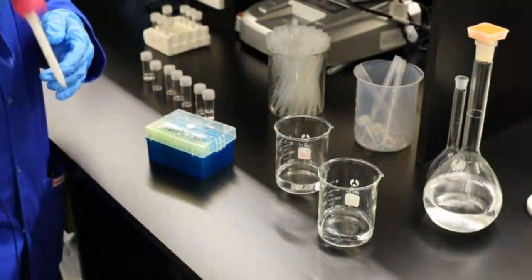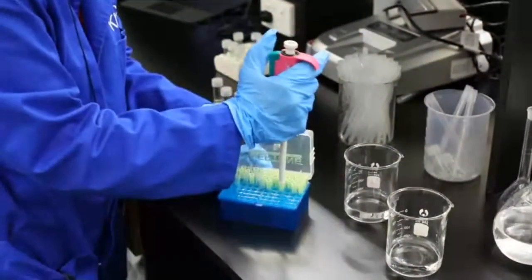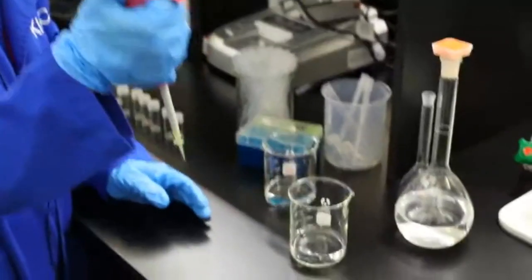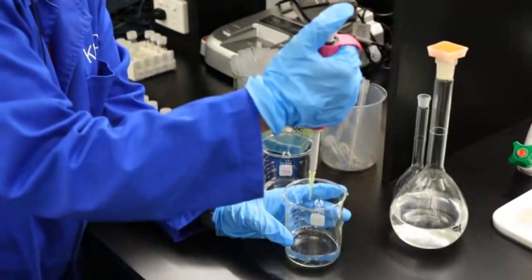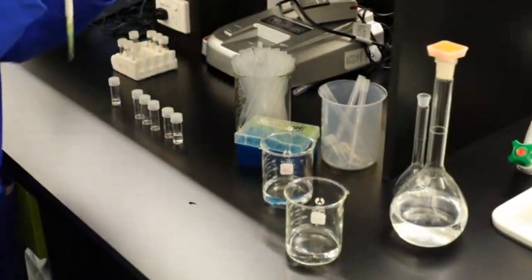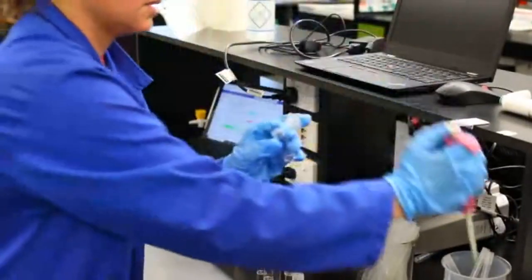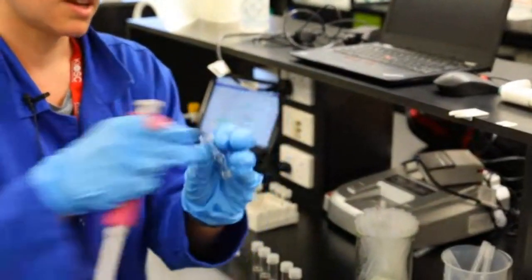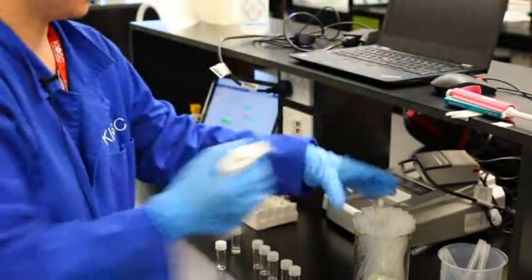Now in this case, I need to get 30 microliters, so I need to use the little guy here, and he has a little tip that goes on. I'm going to be putting 30 microliters in, just like we did before, first stop, into our first one. Now 30 microliters really isn't that much. It's 30, my apologies. And we're going to be putting that into there. So it's this tiny little amount there. And now what we need to do is top that up with our water.